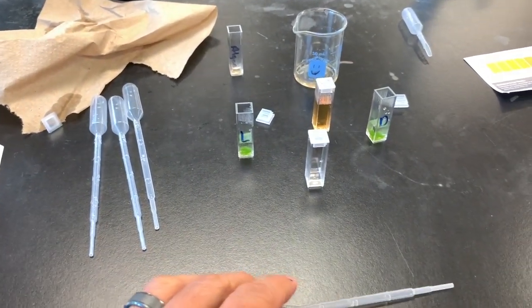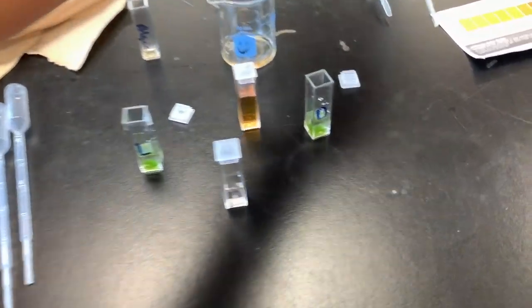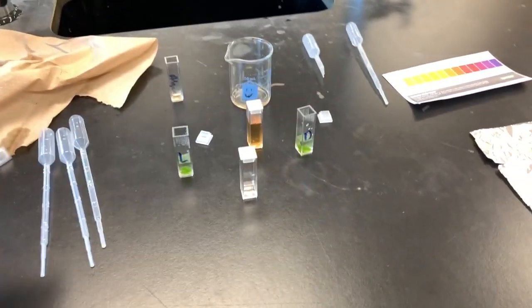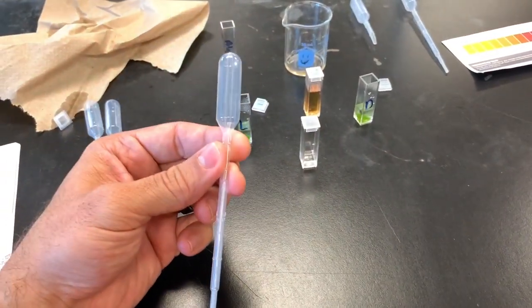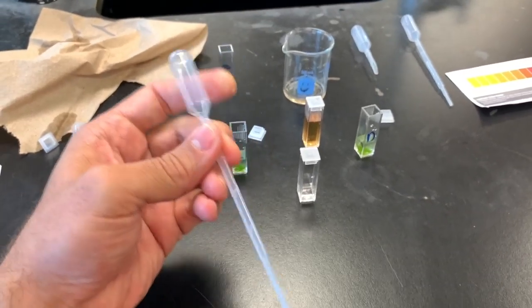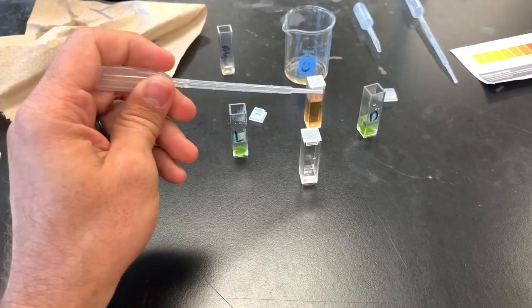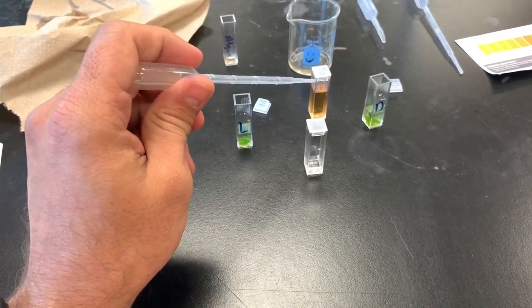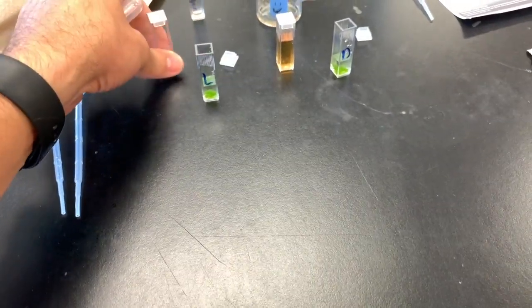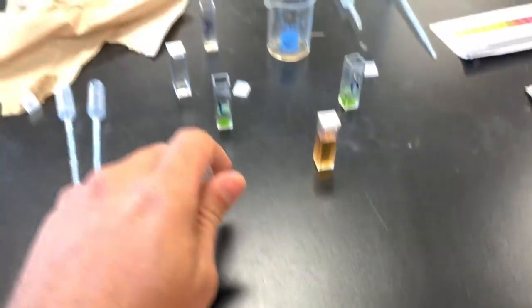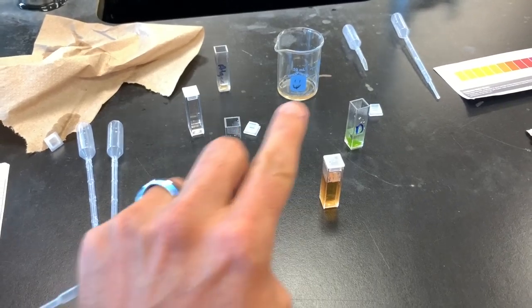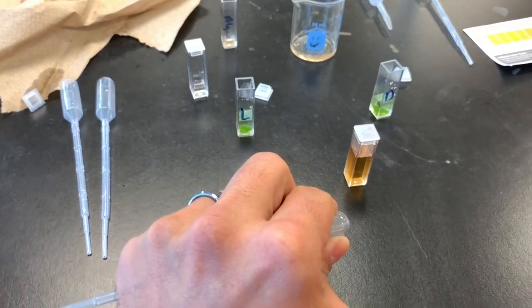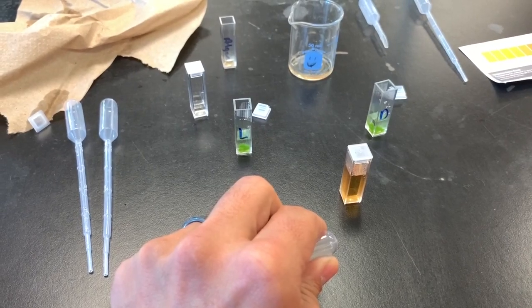After that time, you then will take, you can discard this pipette and you're going to grab a new pipette, and you're going to then transfer one milliliter of the indicator solution into each one of these. And then you're going to cap them.